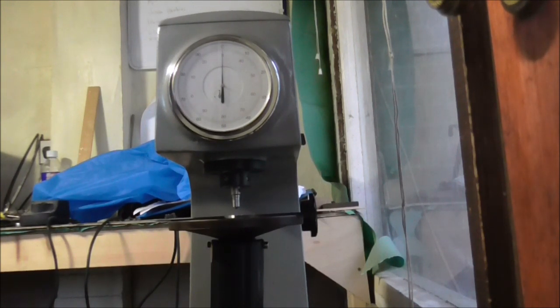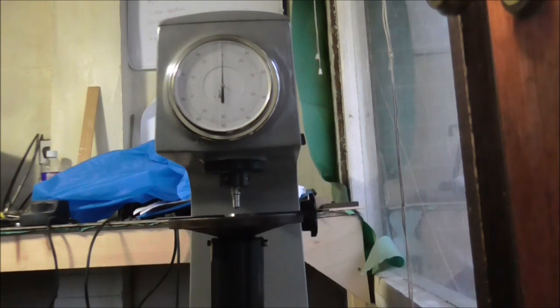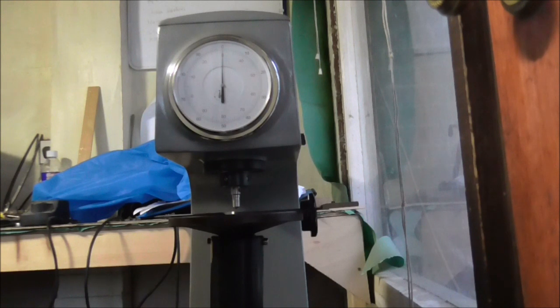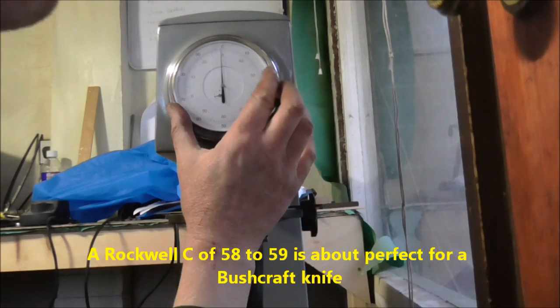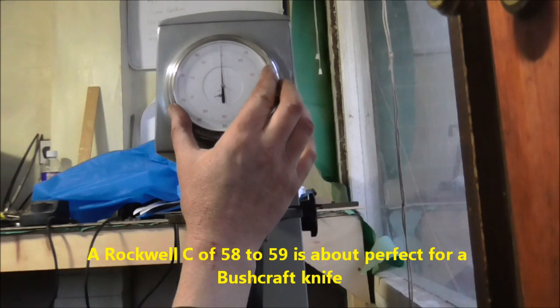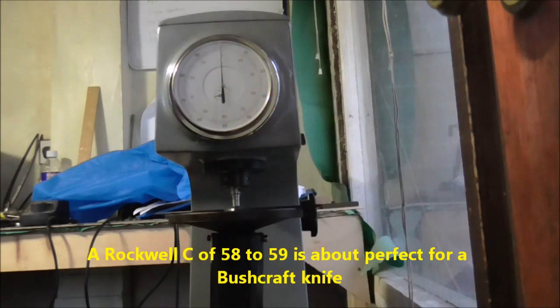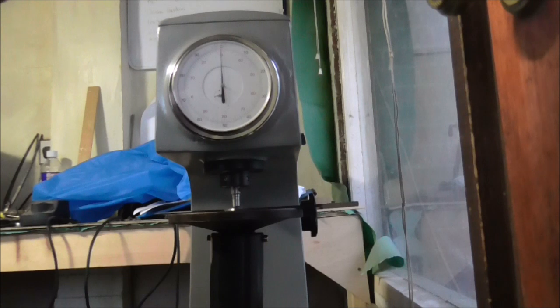Now I'm going to test one of my knives. Bring the load up to it. One. Two. Three. Just adjust that so it's bang on to the C. Then impart the main load.